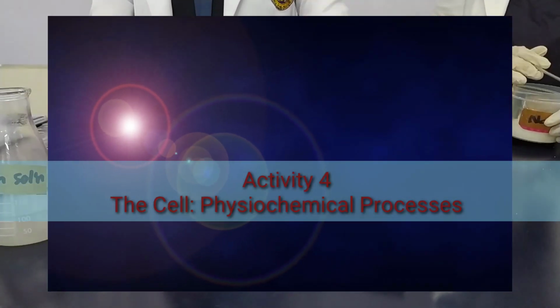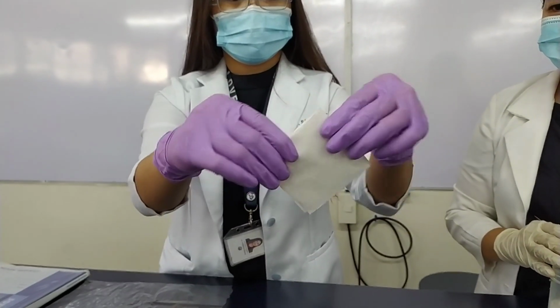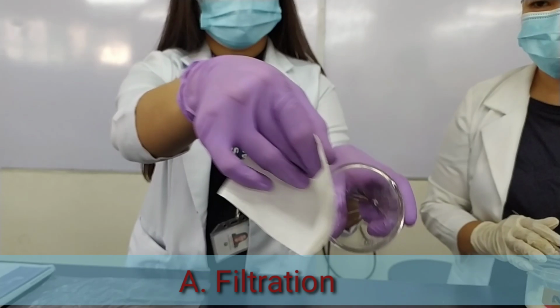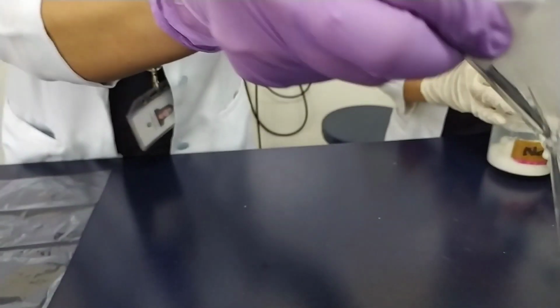So today, class, we will perform the physiochemical processes of the cell. And now, we have our first procedure. This is what we call filtration. But first, you have to make a filtration setup with a filter paper lining the funnel.